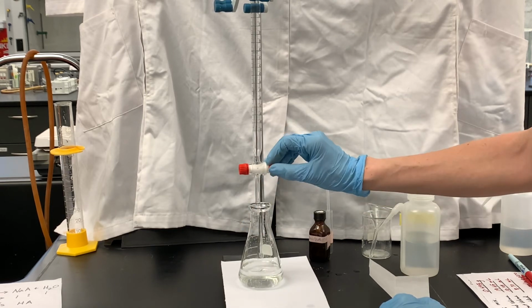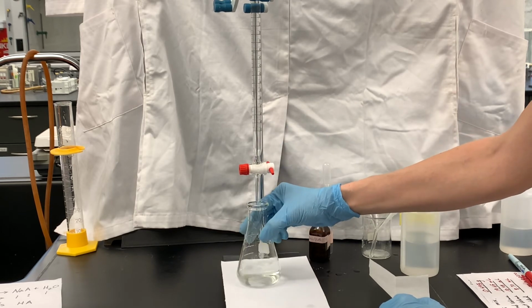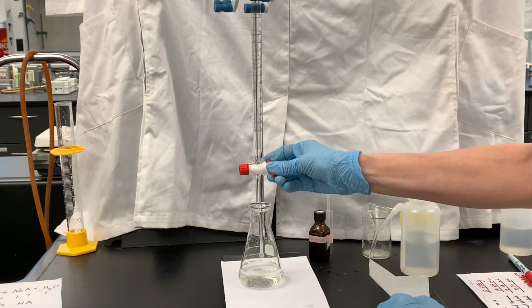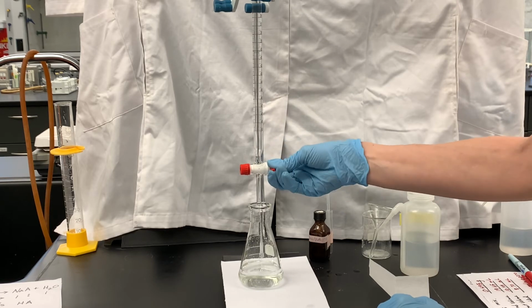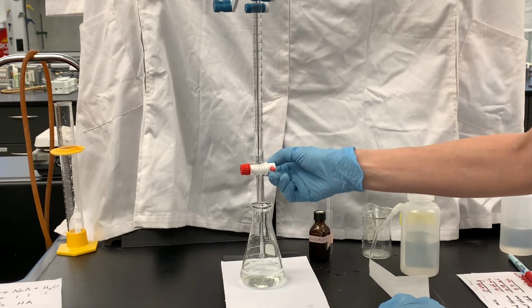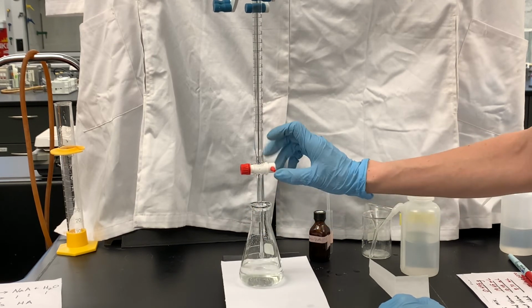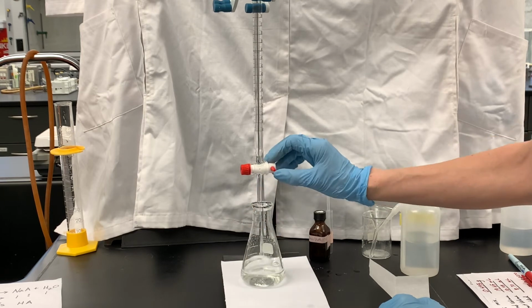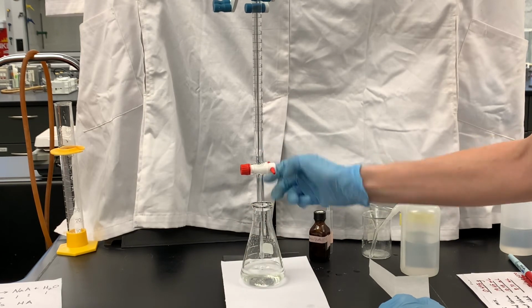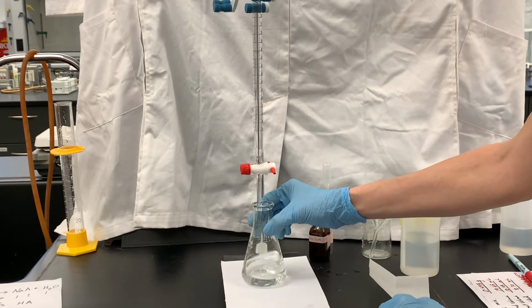And also in titration, my technique here, instead of trying to set the burette up to go drop by drop, which takes a lot of time, is to move the stopcock 90 degrees from one closed position to the next closed position. It's a pretty easy motion, and it adds just a really small amount, less than a drop.